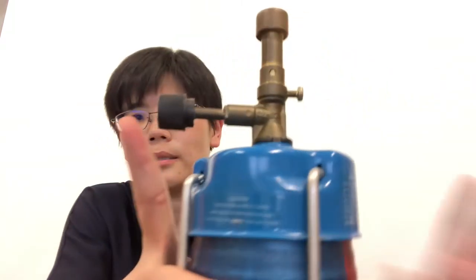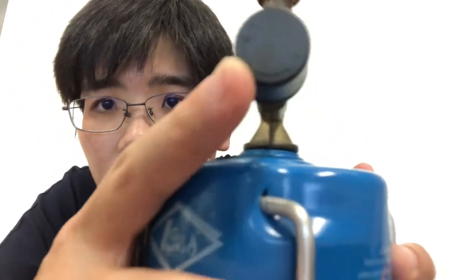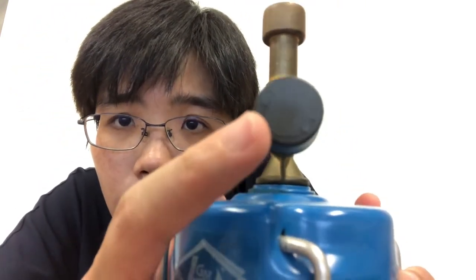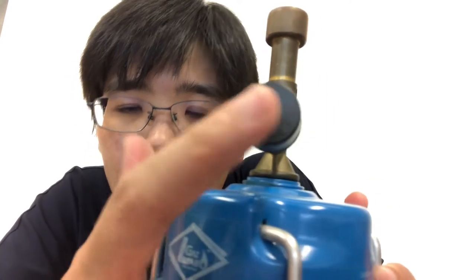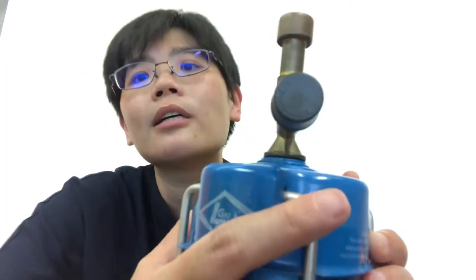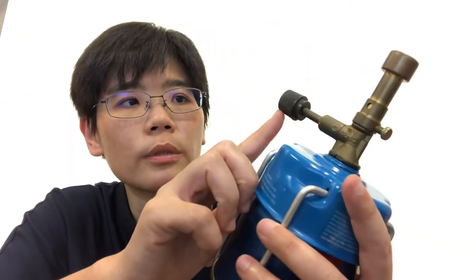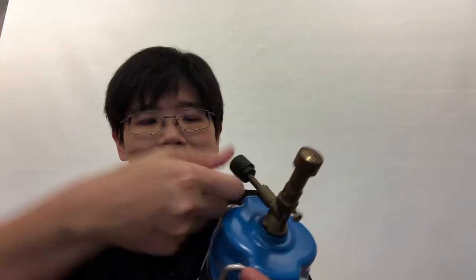Then, what we need to do is close the air hole and turn on the gas. Where is the gas? It is this knob that sticks out. You will notice that there are some things printed on the knob. There are two arrows, one clockwise and one anti-clockwise. One of them is plus, one is minus. Plus means more fuel. You will turn towards the side that says plus. You don't turn blindly. You look at it, look for it until you find it, then turn towards the part that says plus to turn on the Bunsen burner.